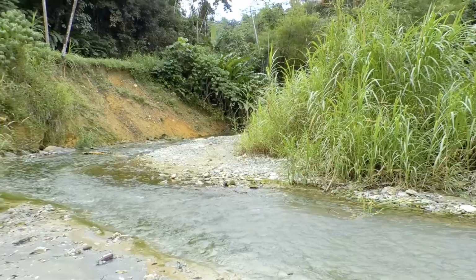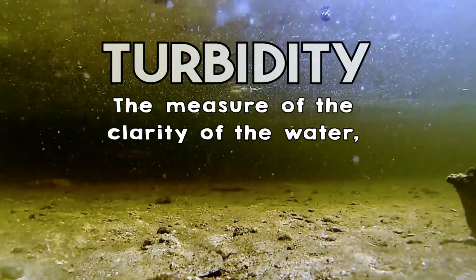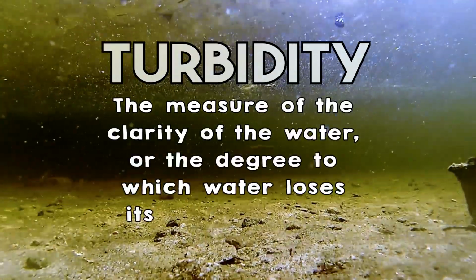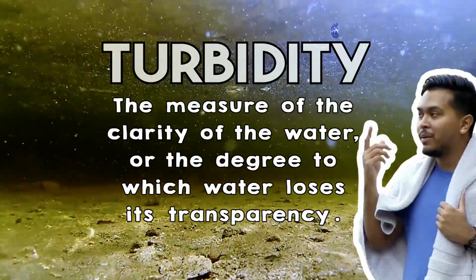And we both can agree that the color of the water is off. And that's just from a visual observation. Okay, I get that. And it also looks cloudy. Yeah, that cloudiness has a direct link to turbidity, which is a measure of the clarity of the water or the degree to which water loses its transparency. Well, we in these parts just say the water is cloudy.